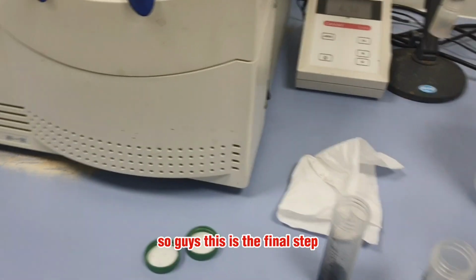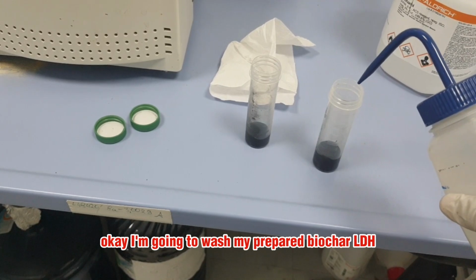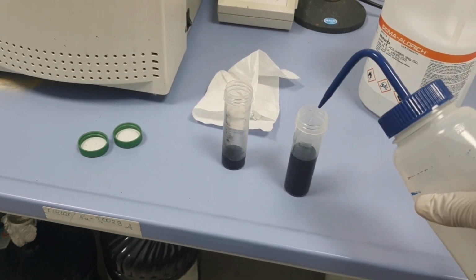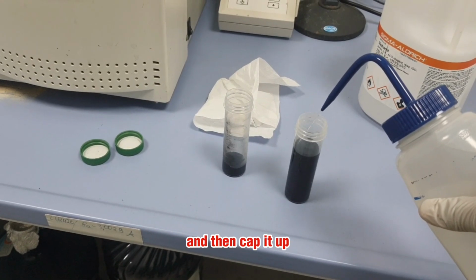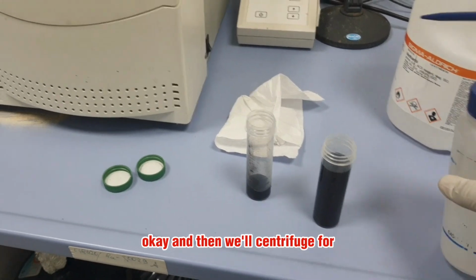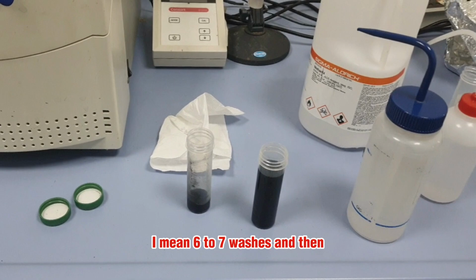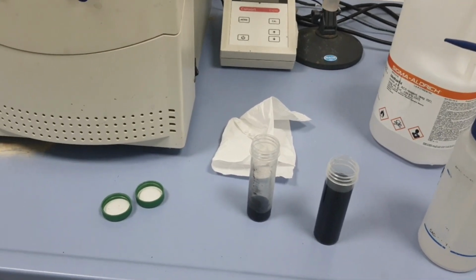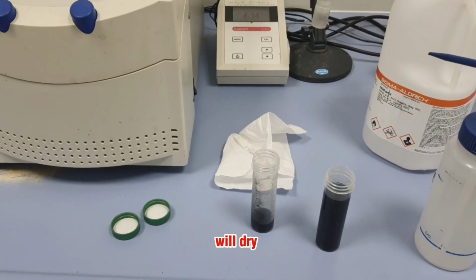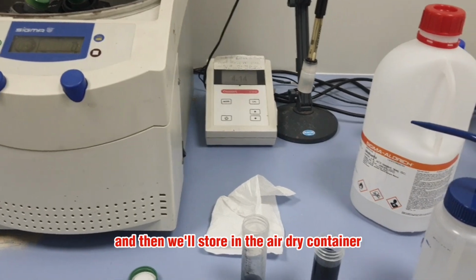So guys, this is the final step. I'm going to wash my prepared biochar LDH. I will add water, cap it, and shake the whole assortment. Then we'll centrifuge for 6 to 7 washes, and then we'll dry, grind, and store it in an airtight container.